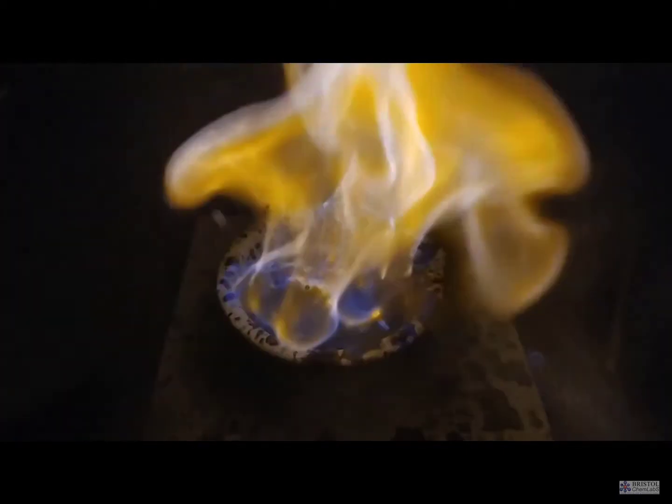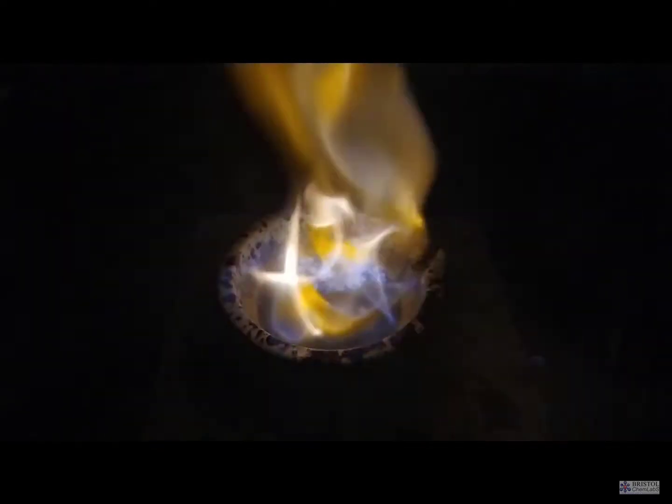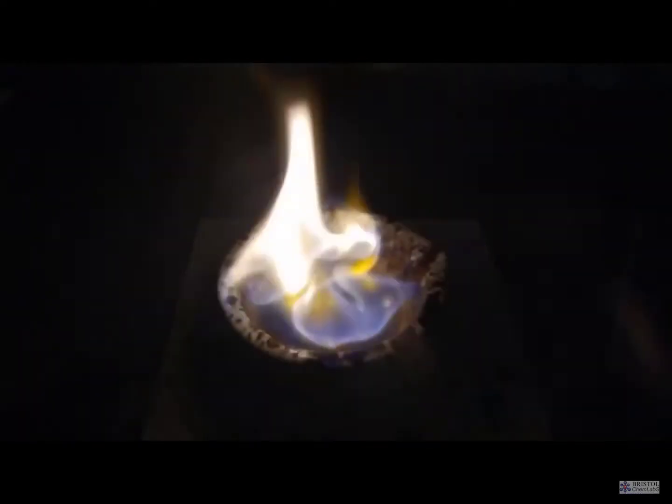The reaction is an interesting one. If you consider what's going on, the reaction with potassium manganate(VII) and hydrogen peroxide liberates oxygen, which causes faster burning. An alkali is formed because we're generating hydroxide ions, and a browny black solid of manganese(IV) oxide, MnO2, is formed, and this makes the mess.